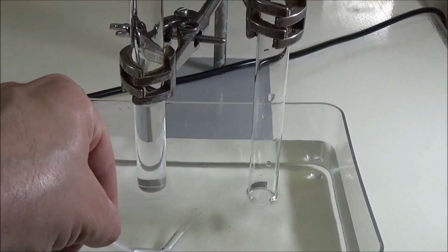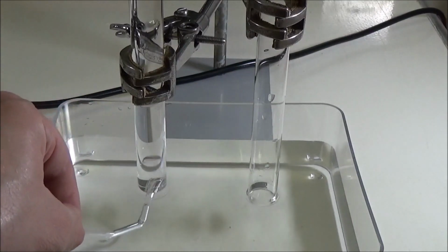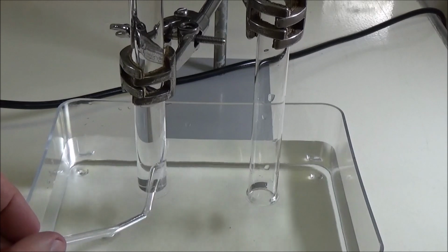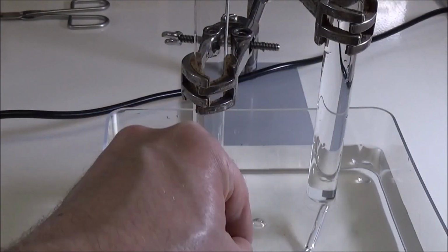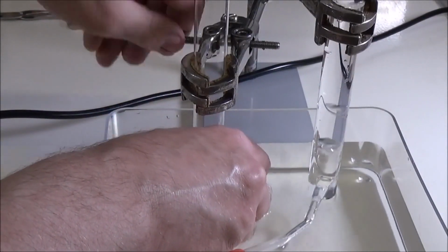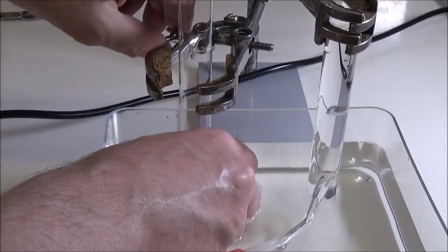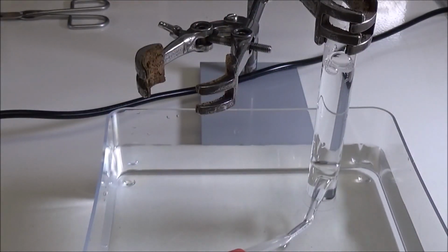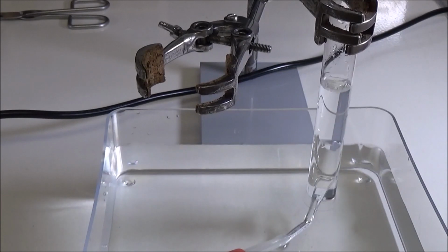After the first test tube was filled with gas, it is replaced by the second one. The content of the first glass is discarded since it mainly contains air that was previously in the apparatus. After the second test tube has also filled with gas, it is sealed with a rubber stopper while still underwater and removed from the apparatus. Previously, the first test tube was again filled with water, which is now also displaced again by the gas.